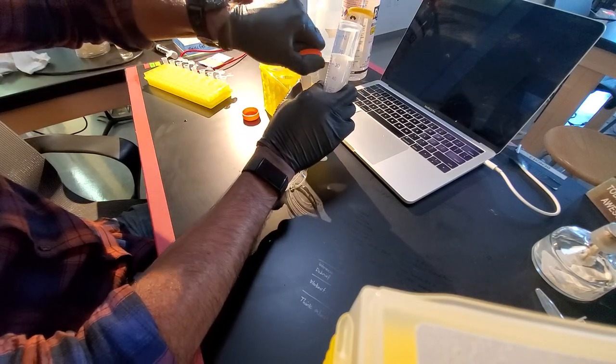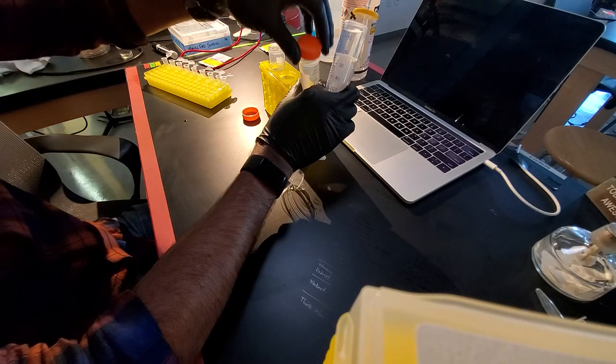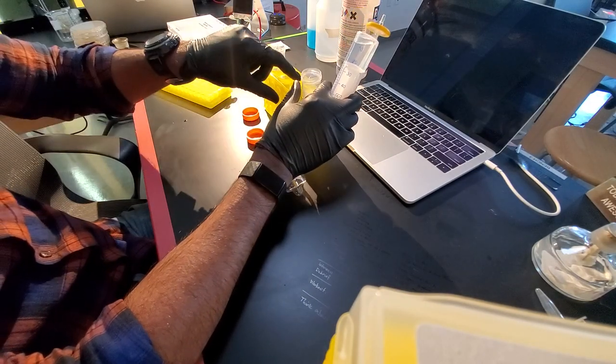So I'm going to take this tube. I'm going to make sure that I put my cap upside down so that none of the inside of it comes in contact with the ground.